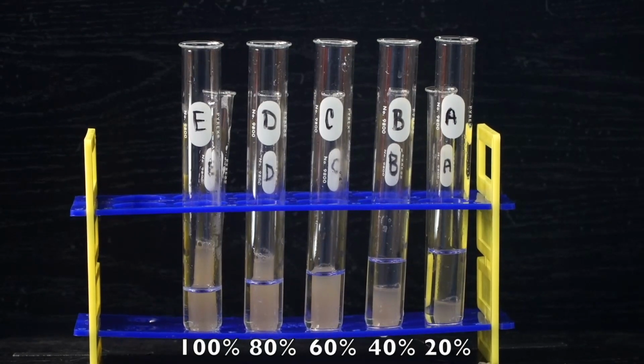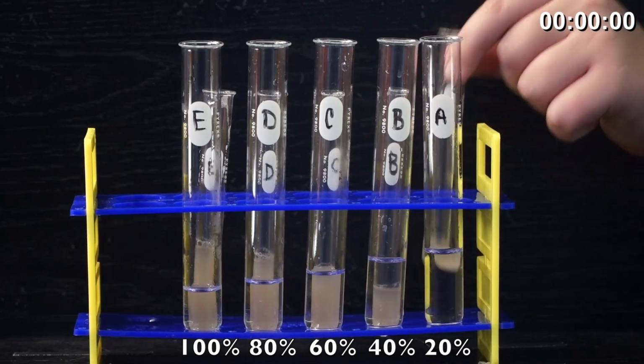All right, this independent variable in the enzyme investigation will measure the effect of changing the concentration of our enzyme, which is from the red potatoes, and it's called catalase. So go ahead and add the contents of the small test tube, which will be the catalase, to the large test tube, and as soon as that's done, the timer will start.